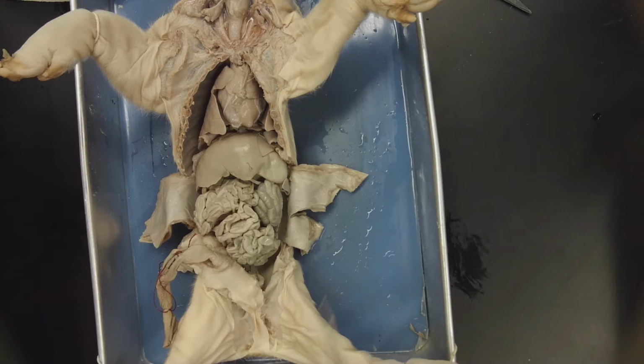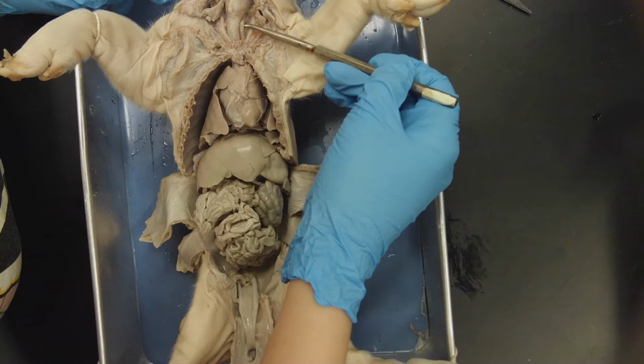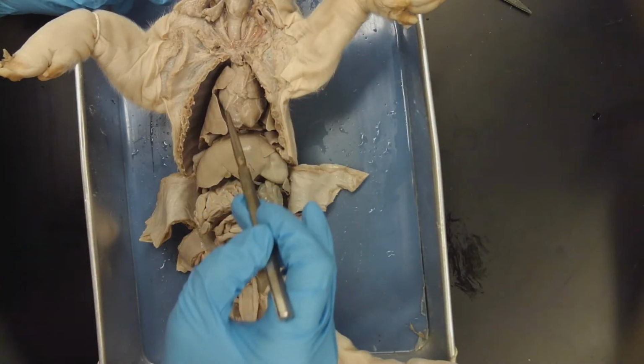You can see that I've already opened the thoracic and abdominal cavities, and I've also resected the tissues that cover the internal structures of the neck so we can easily spot the trachea. We can look just dorsal and to the left of the trachea to find a much smoother tube called the esophagus. The esophagus carries ingested materials from the mouth to the stomach, passing through the diaphragm on its way.